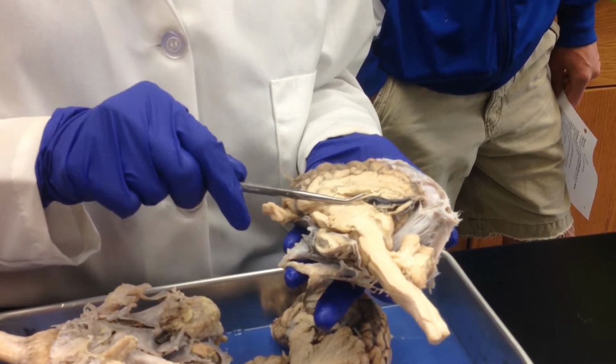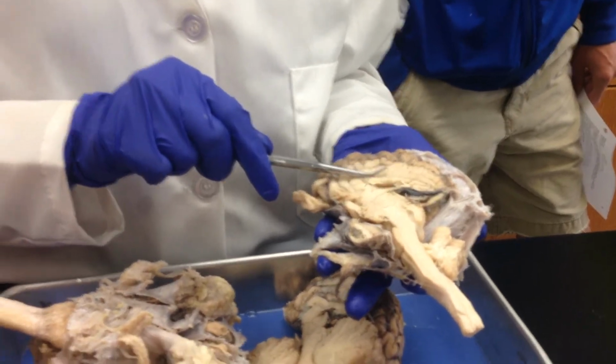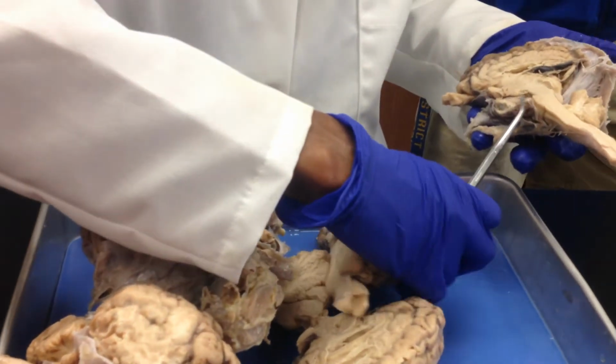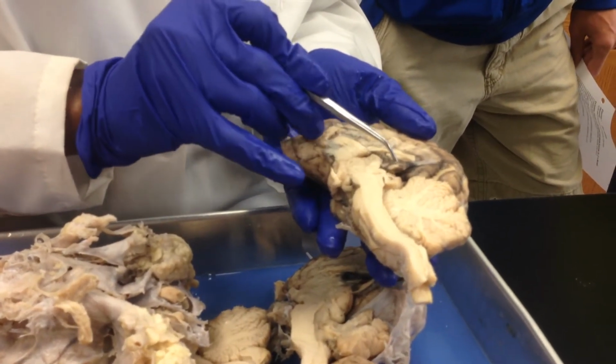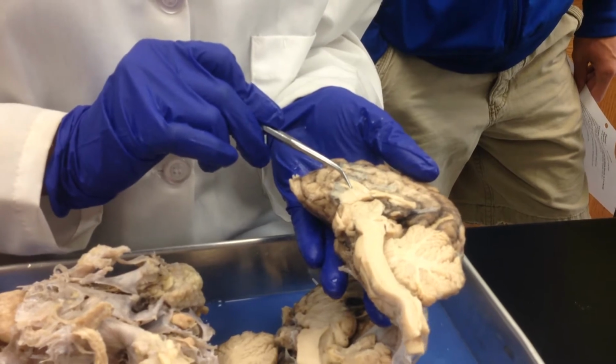So when you took this area off, you would have had the membrane called the septum pellucidum that covers this area. Now, you're not going to be able to see the pineal gland in every one. Actually, you can see it on this one. See right here? That's the pineal gland. There's the choroid plexus, the intermediate mass of the thalamus, fornix, and corpus callosum.